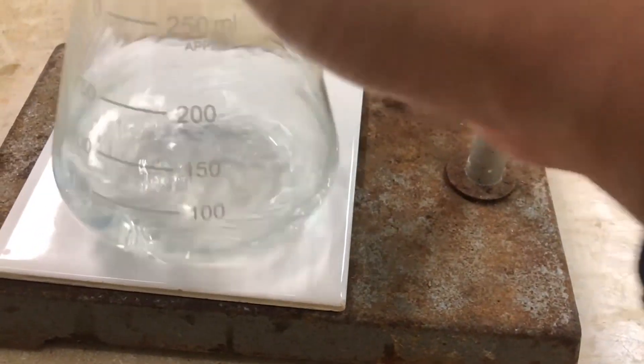Every drop, a swirl and an observation. The end point is determined by the point whereby a drop actually causes a permanent color change. So in this case, it seems like we are looking for a color change from colorless to blue.